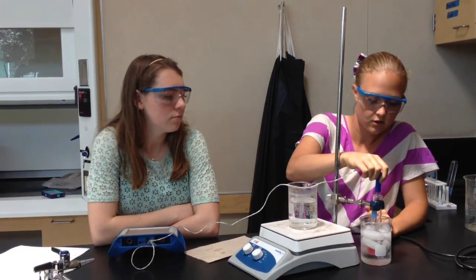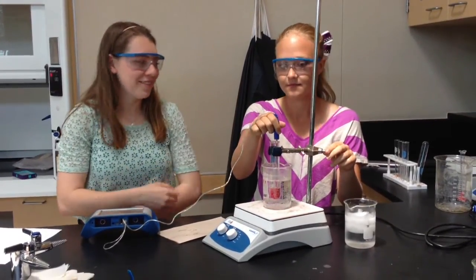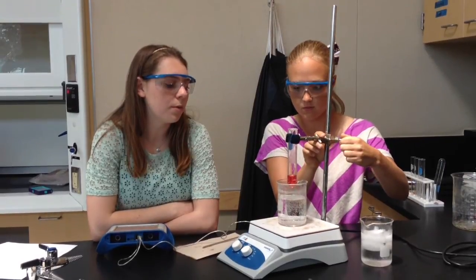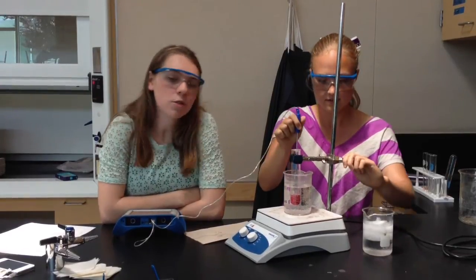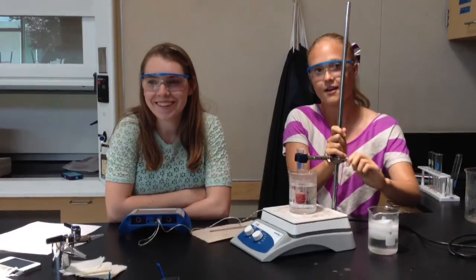And make sure you stir the stuff. Are you holding it? Okay, she's holding it. And we're gonna need to redo that. Stop. Put it back in the boiling water. Okay, guys, so our lauric acid's melted. It's only taken a couple minutes. Natalie, shut up. Wow. Oh my God, Natalie!